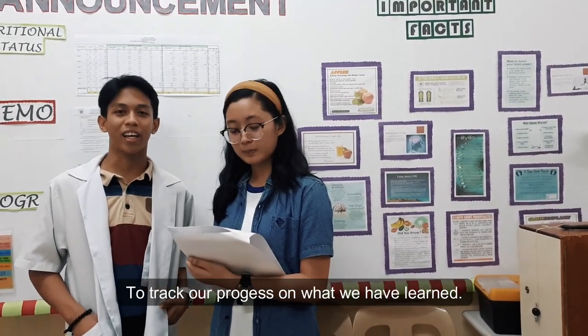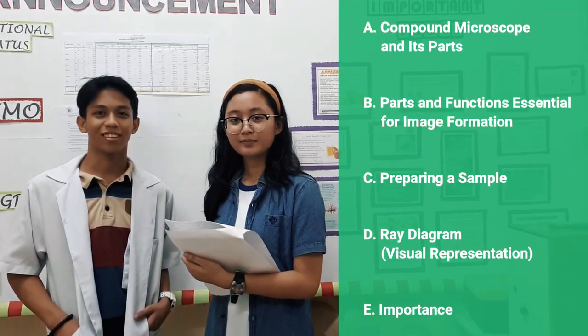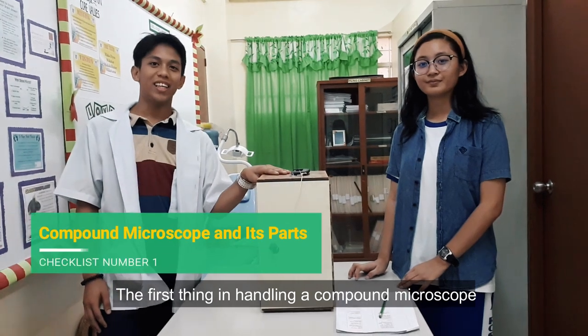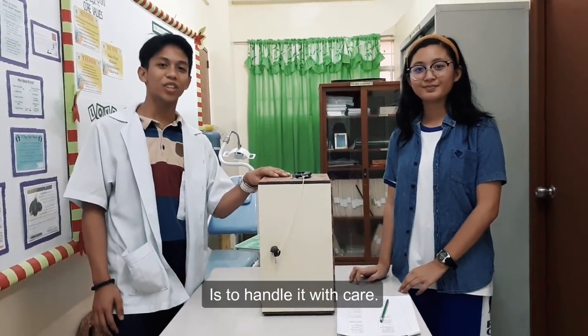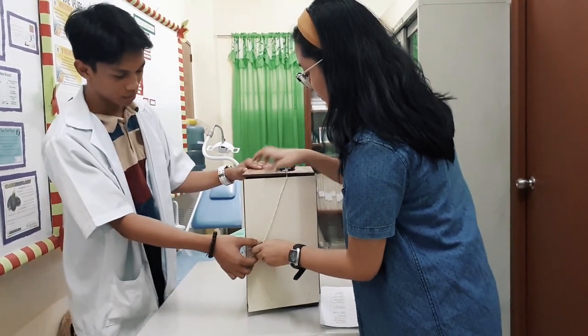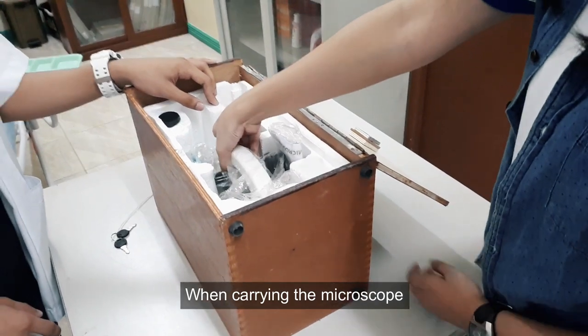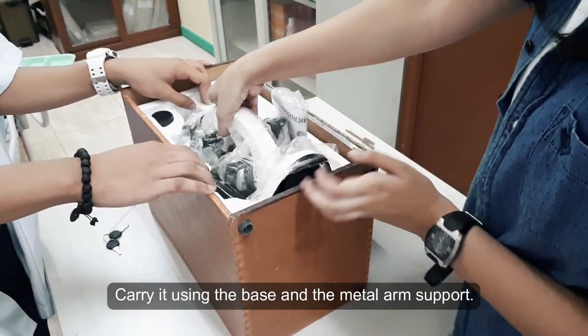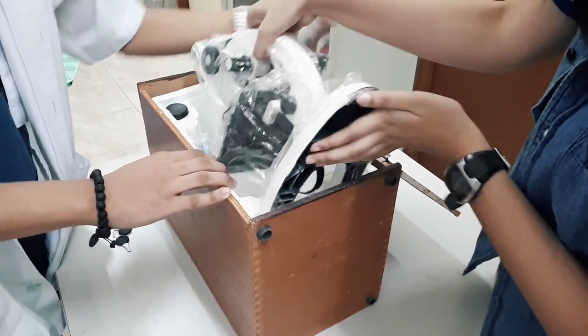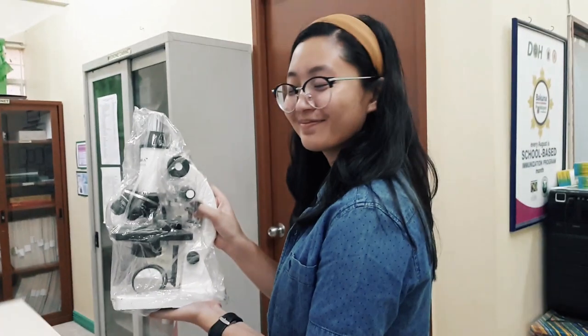To fully understand everything, we will be needing these techniques to track our progress on what we have learned. The first thing — when carrying the compound microscope, carry it using the base and the metal arm support.